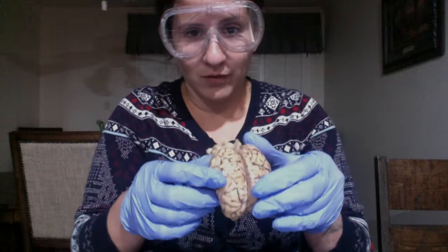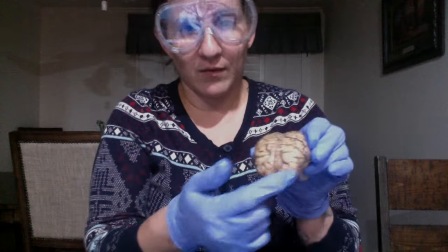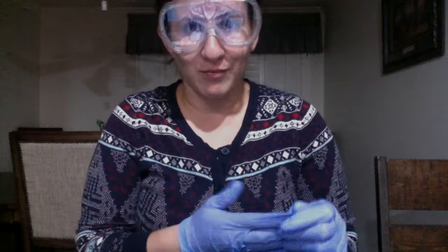So this is my short video showing you my sheep brain. And once again, we have frontal, parietal, temporal, and occipital. Thank you for joining me on my sheep brain dissection.